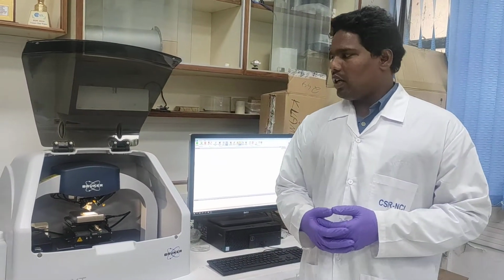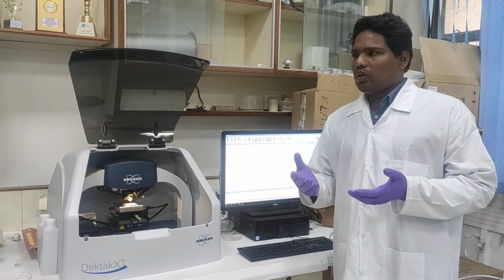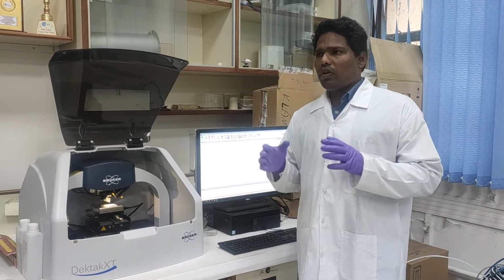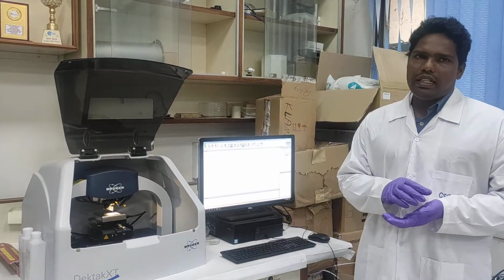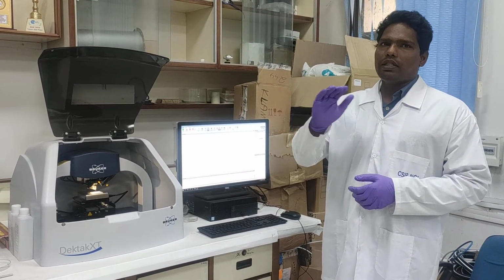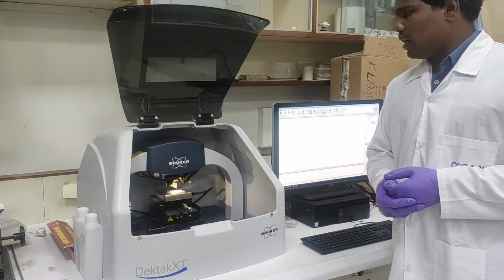So now I am going to explain the importance of the surface profilometer. Actually, here we are doing photocatalysis. In photocatalysis, we are using powder catalyst as well as thin film under direct sunlight, and we are doing the reaction. Before the reaction, the importance of our work is that the amount of the catalyst should be optimum. So here we have the surface profilometer, and the thickness of the samples coated on the FTO or some glass material we can analyze. Here you can maximize things actually.